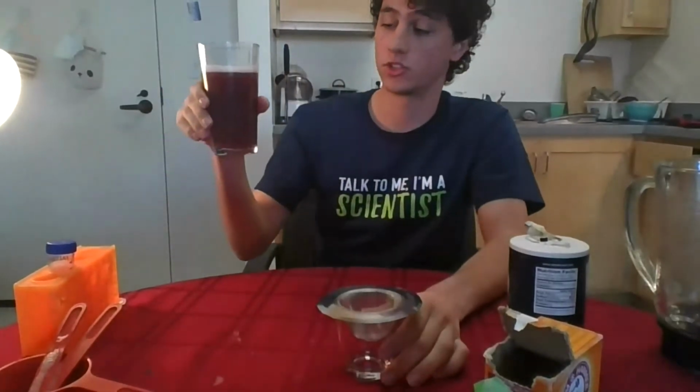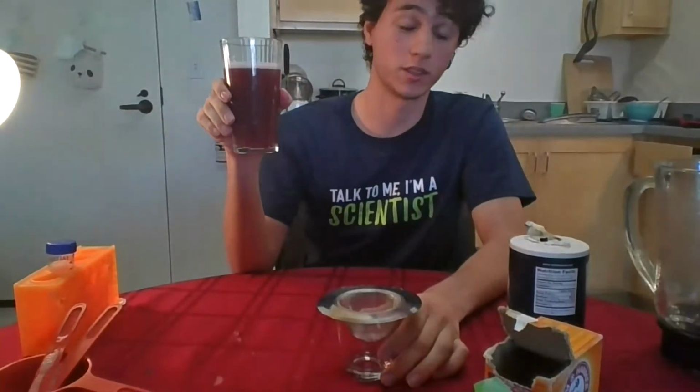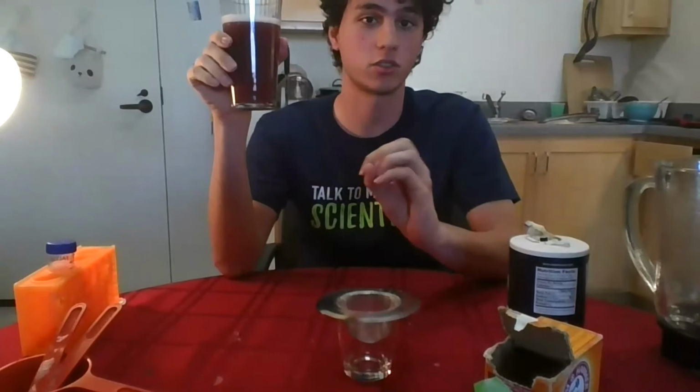Already, perfect. I'm going to spotlight myself, and here we are. I've been stirring the soap with the strawberry blend for quite some time now, and it looks pretty homogeneous. It looks pretty well distributed. So now I'm going to go ahead and do what Gabriela was talking about. I'm going to drain the big chunks of strawberry that are still left in the blend into this small glass here.